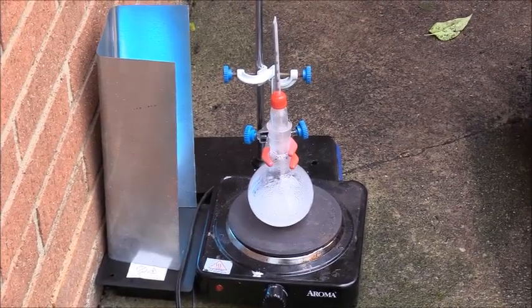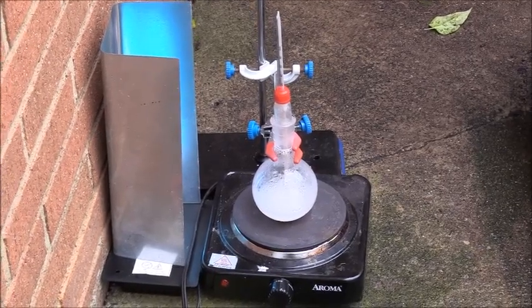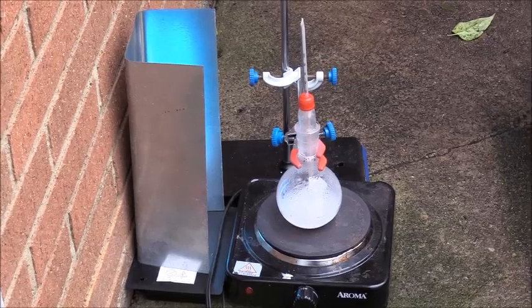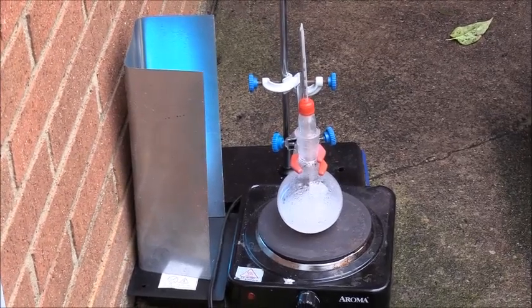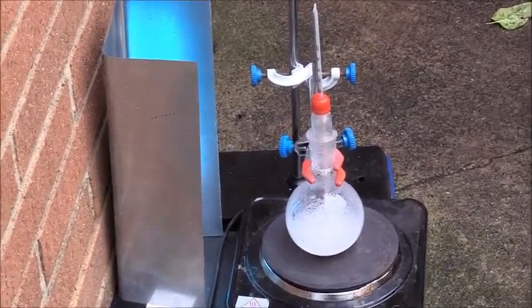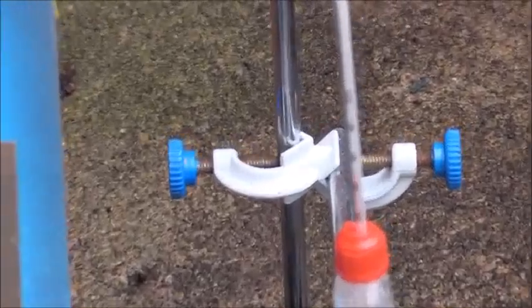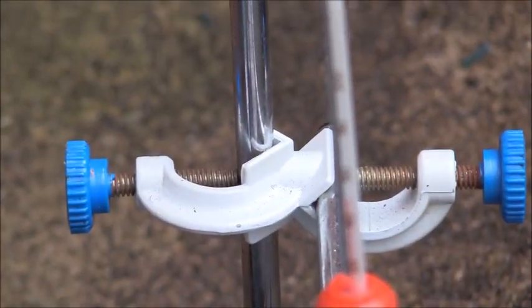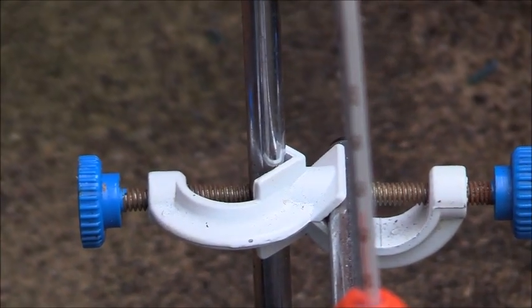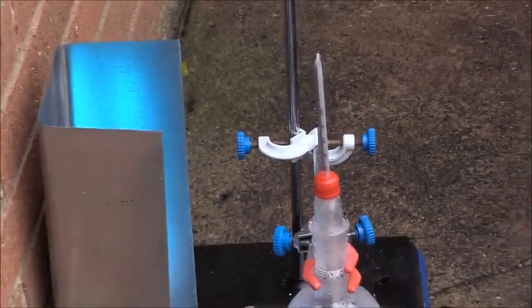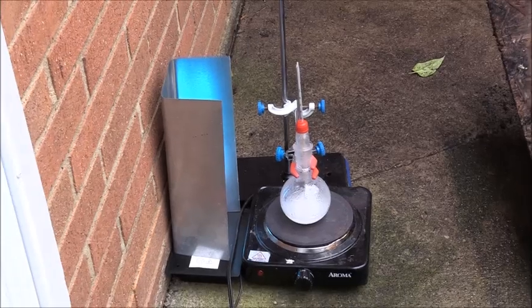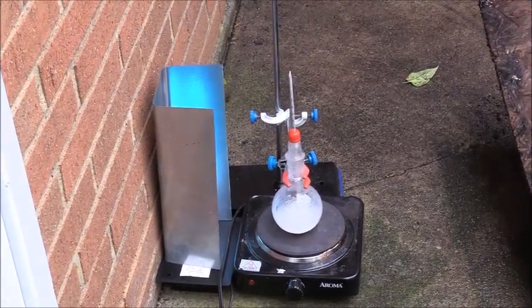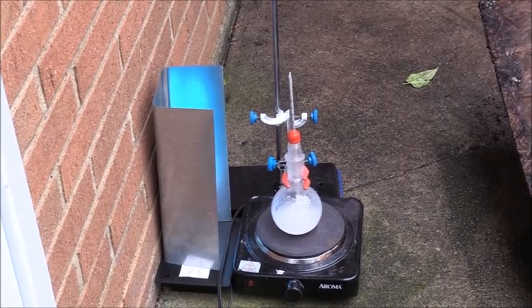So as you can see I have moved this experiment outside because not only are formamide vapors toxic, but some of the products produced from this experiment are also toxic. Right now I only have one UV light shining onto the flask, but I plan to have another one very soon. So the goal is to heat this flask at 150 Celsius for 48 hours and also expose the solution to 72 watts of UV-C at 254 nanometers.